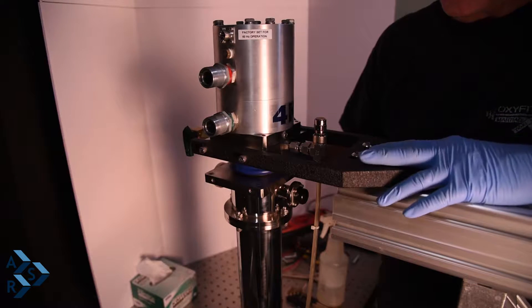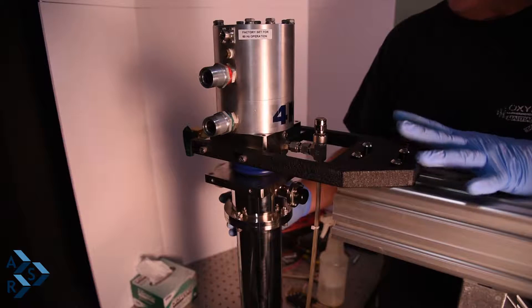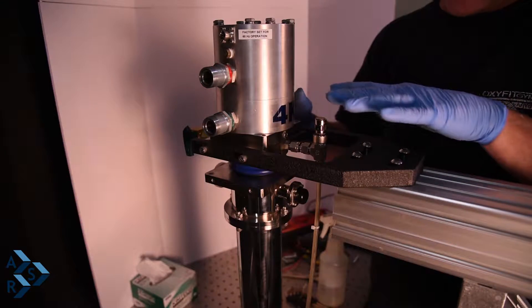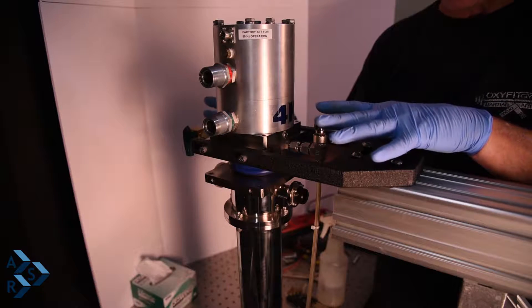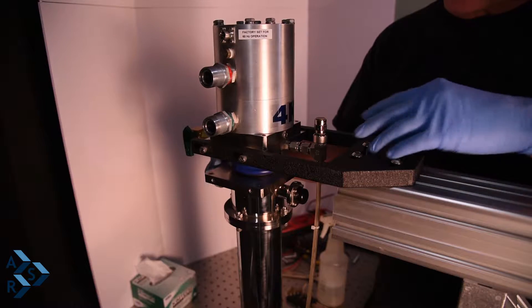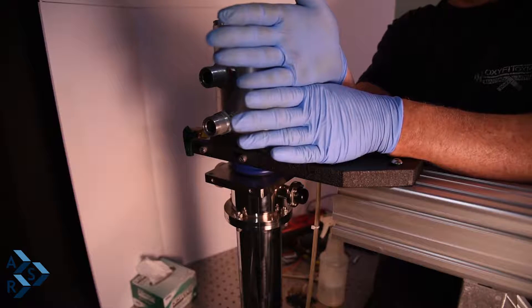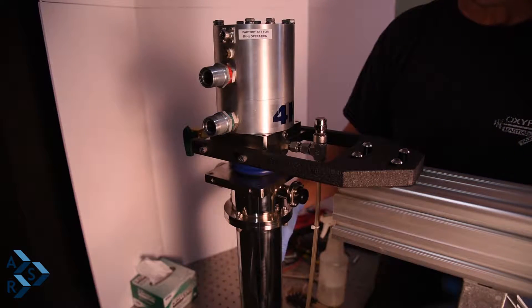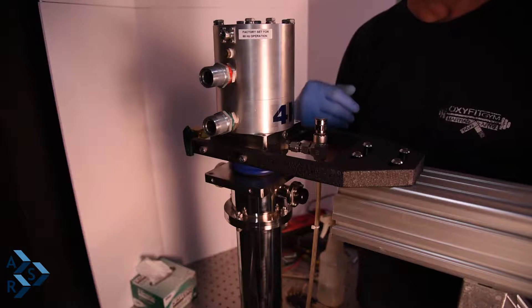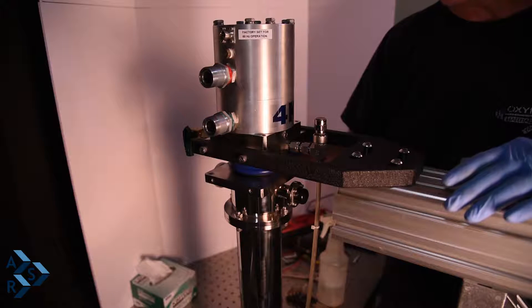The whole reason for that check is to make sure your fit-up is done well and done right. If you do get a short, something is off and you're going to have to maneuver it around — left, right, up, down. You don't want them to be offset because that is how you create a thermal short inside where the cryostat is touching. Make sure these are parallel to each other all the way around — that is a critical part of the installation. Just take your time and make sure that it is set up correctly.